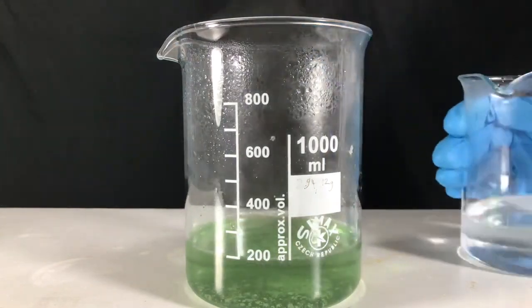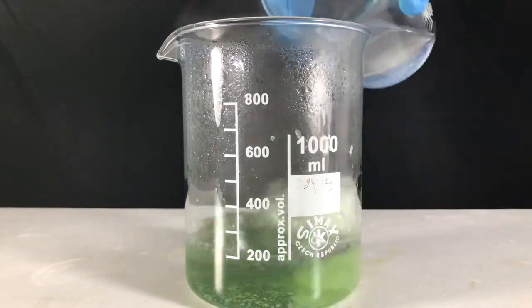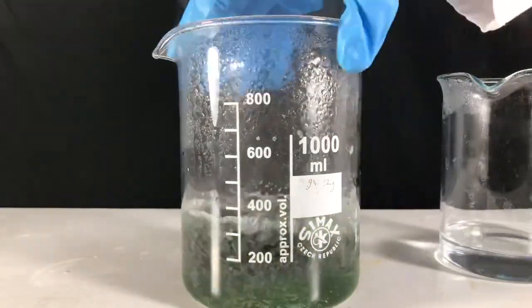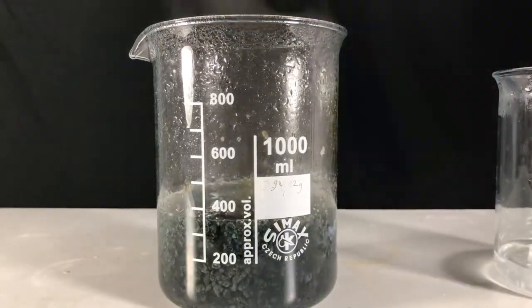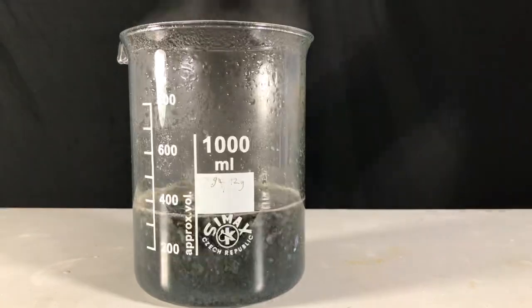In the beginning, there is absolutely no precipitate. But later on, due to its low solubility in water, a lot of iron hydroxide crashes out of solution.